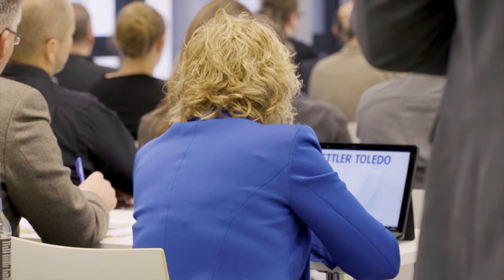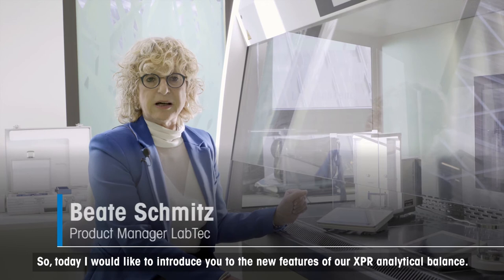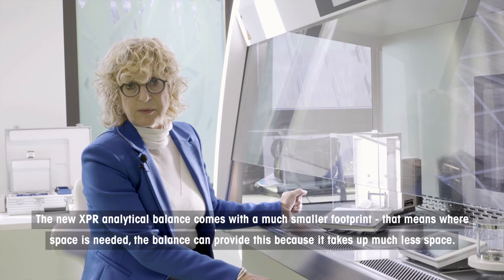Today I would like to show you the new features of our XPR analytical balance. The new XPR analytical balance comes with a significantly smaller footprint — meaning where space is needed, the balance can fit. That means the balance needs much less space.